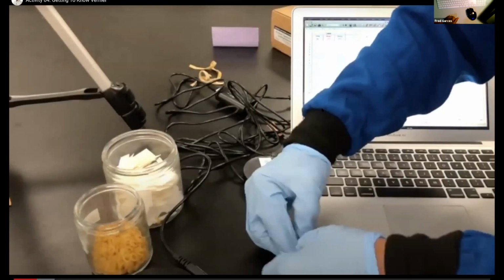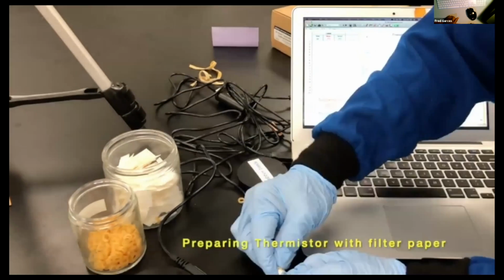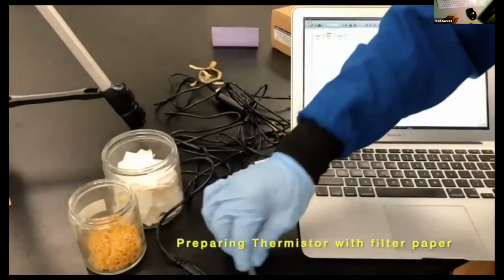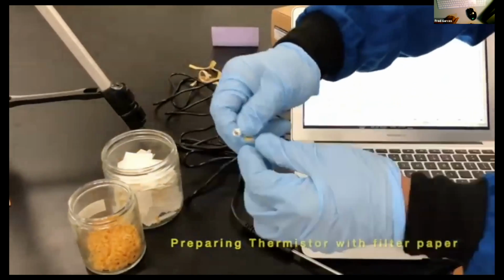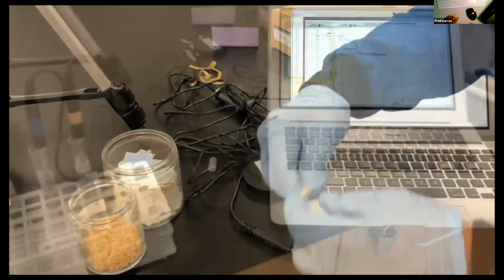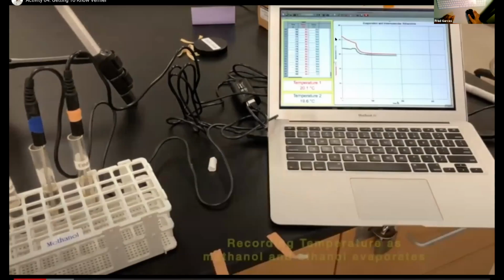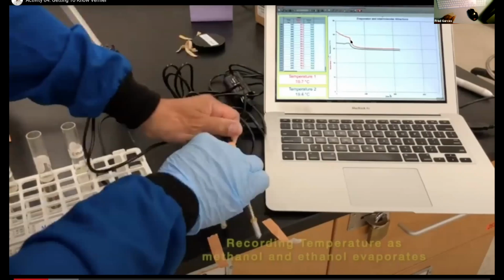Okay, so here's me in fast forward, because I don't want you to just sit there while I do this three or four times, because it was very difficult to put the filter paper on with that small rubber band, with those rubber gloves. Anyway, here it is. What I'm doing now is I turn on the instrument and I let it run so that it equilibrates at room temperature.